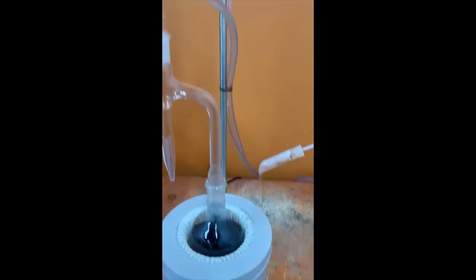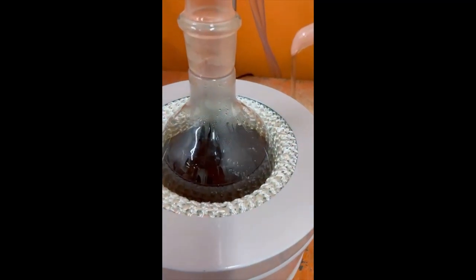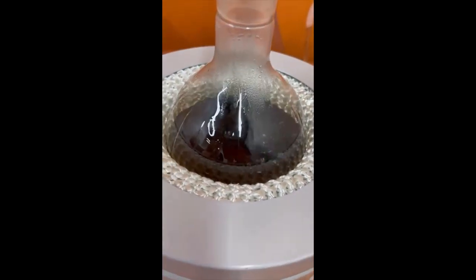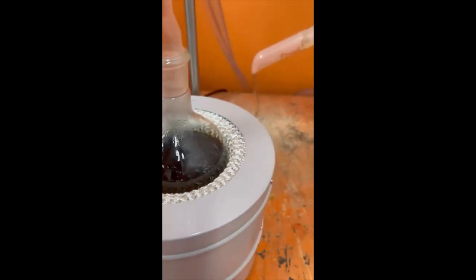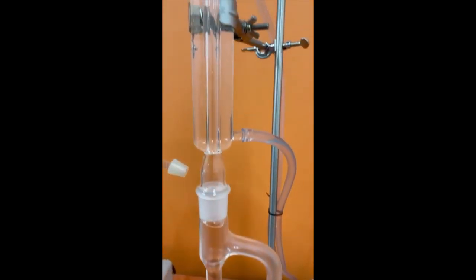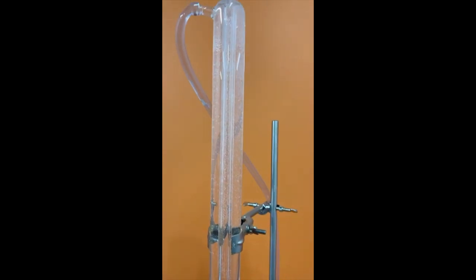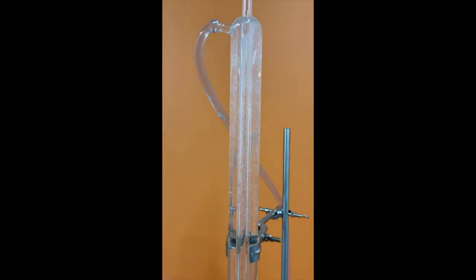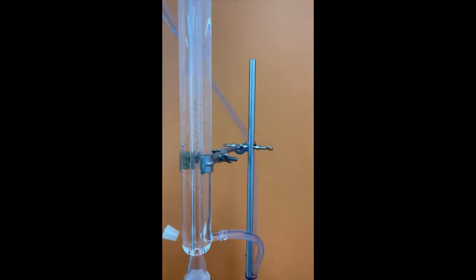Now the test is running. We are waiting for boiling. And the evaporation will go through here and it will condense water. The water content will collect in this trap.